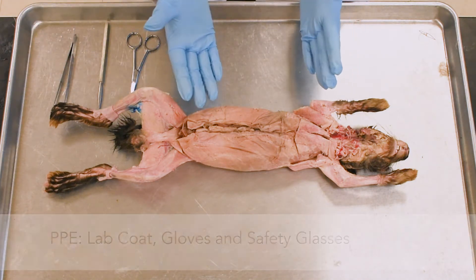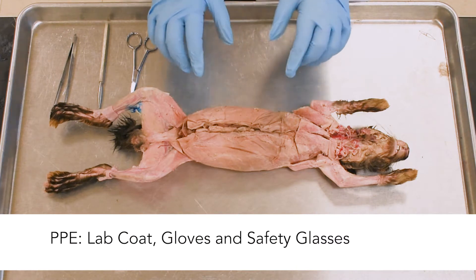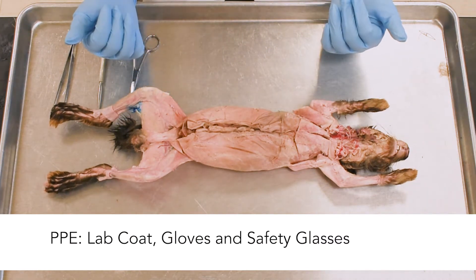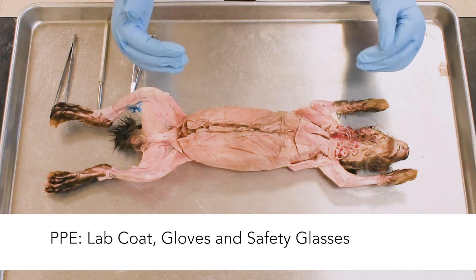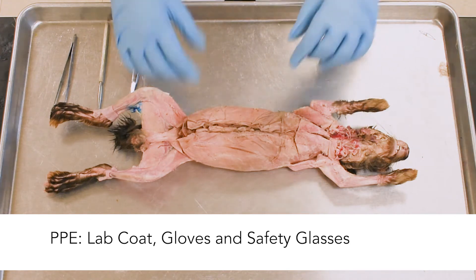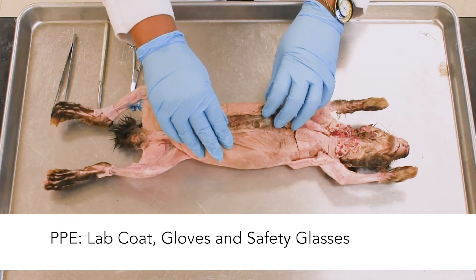Of course you need the personal protective equipment. Wear your gloves, you need the lab coat, and if the preservative smell bothers you, wear the safety glasses.